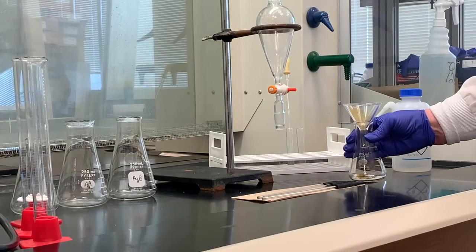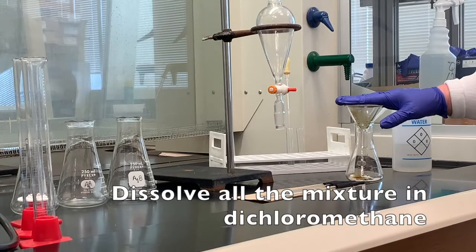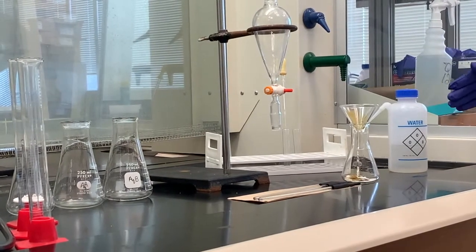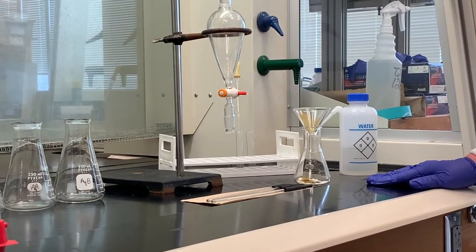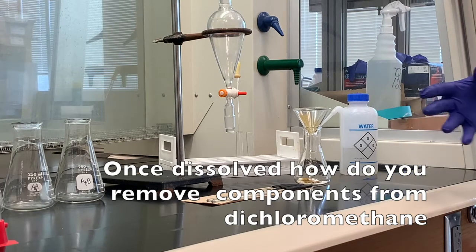So what we're going to do initially is to add dichloromethane to this mixture, and we're going to stir that until everything dissolves. The dichloromethane will dissolve the benzoic acid, the naphthalene, and also the p-nitroaniline. The question is, once they're dissolved in the dichloromethane, how do we remove them from the dichloromethane?